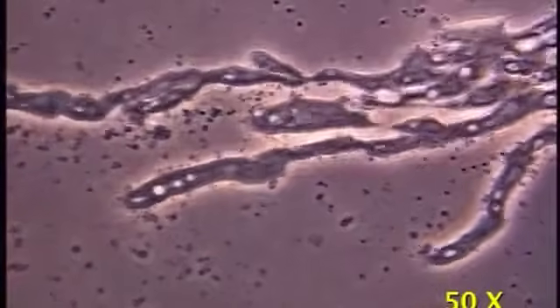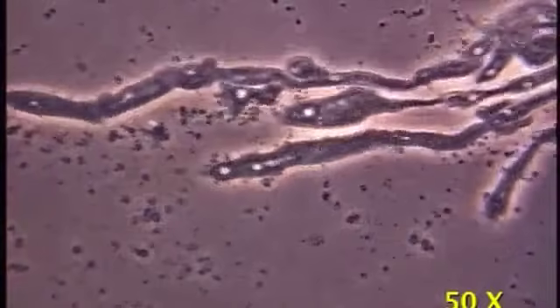The myxamoebae are streaming steadily towards a distant aggregation center. As always, there are a few stragglers rushing to catch up.